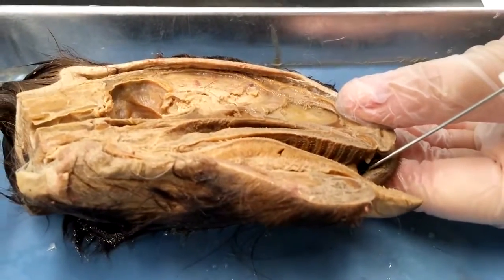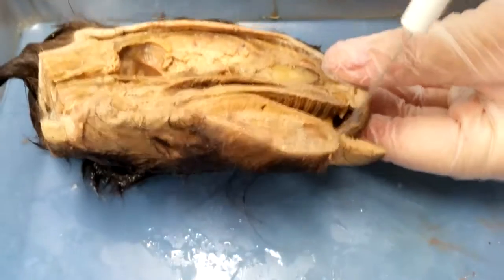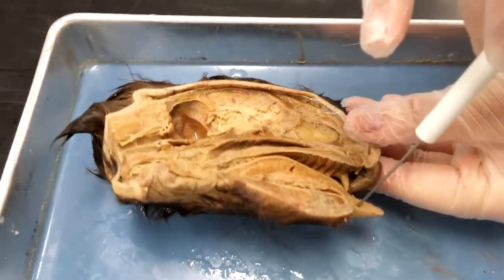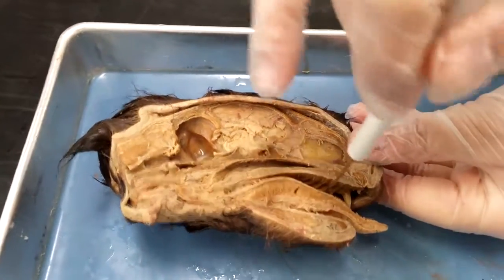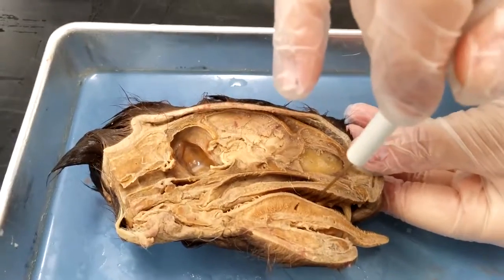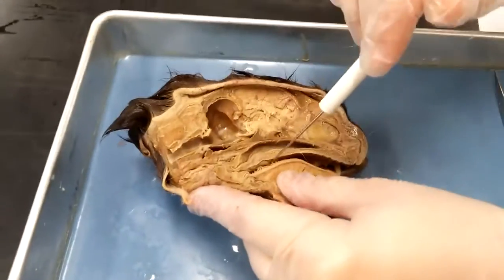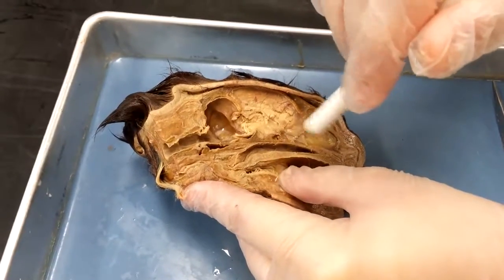Then we have the actual lip, which is this part right here. Then we have the tongue, which is this. Then we have the oral cavity, which is just this open space between the tongue and the top of the mouth. Then we have the soft palate, which is right here, between the tongue and the top of the mouth.